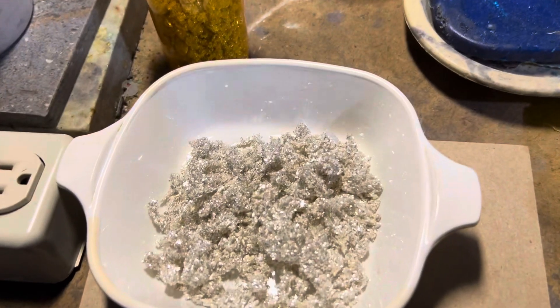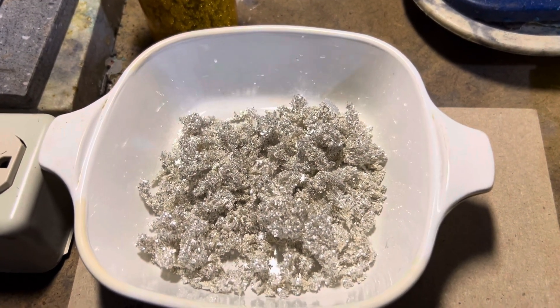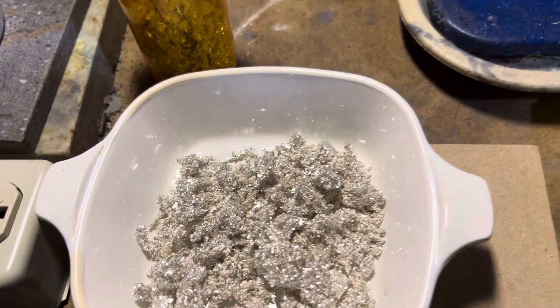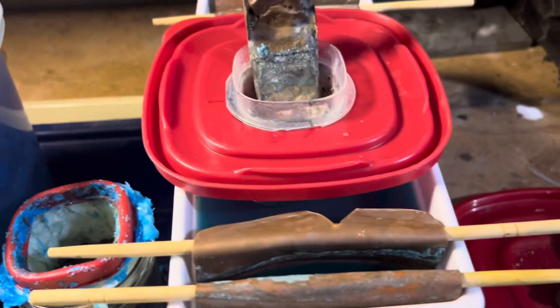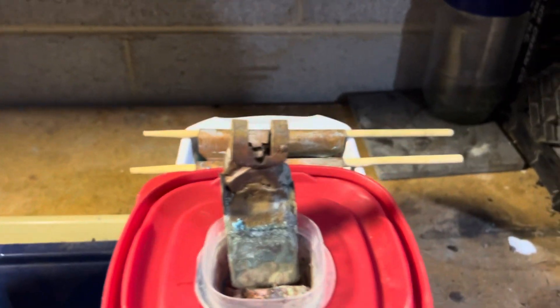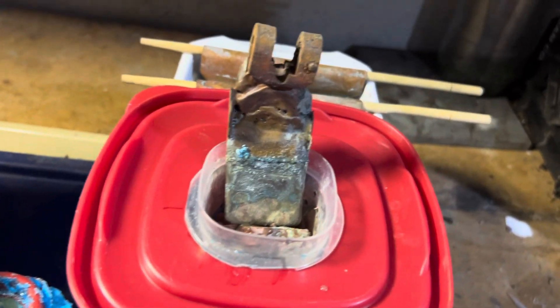I cleaned it another time, but I ran this through a different cell. This is run through a silver cell, kind of similar in theory to this. What we're going to do is just start it up. So what I have here is copper sulfate.